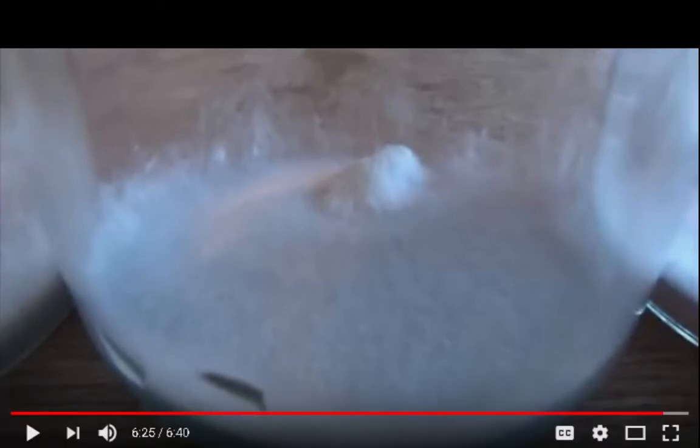So I guess that's pretty much it. Now what I'm going to do is, because I'm studying spores from ferns, let's see, grow ferns from spores. Okay, yeah, it was this video that I was watching here, so let's do that one.